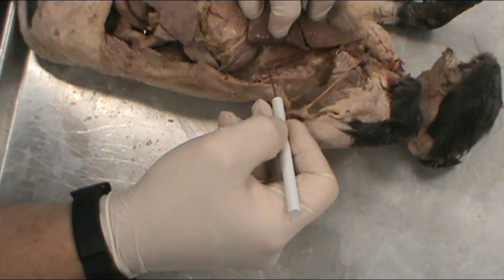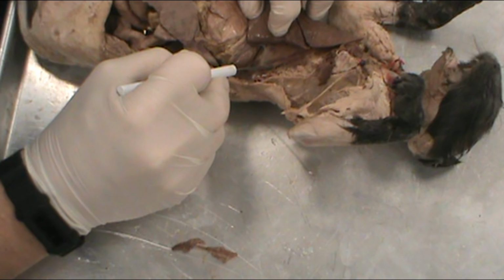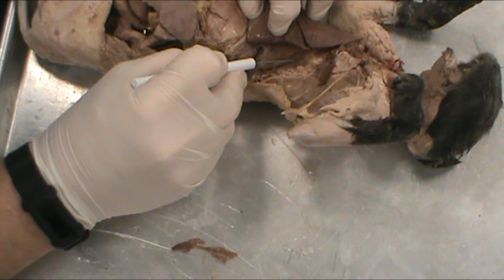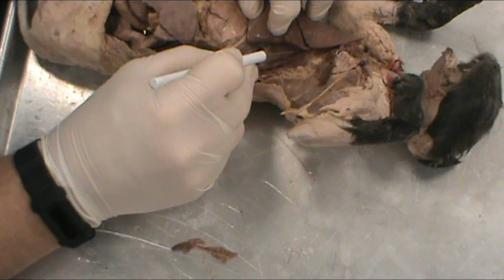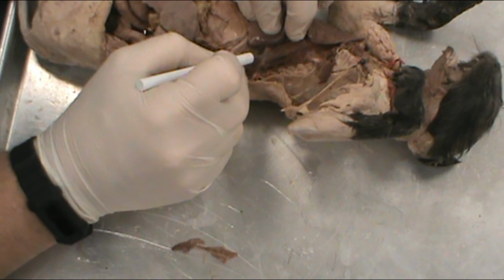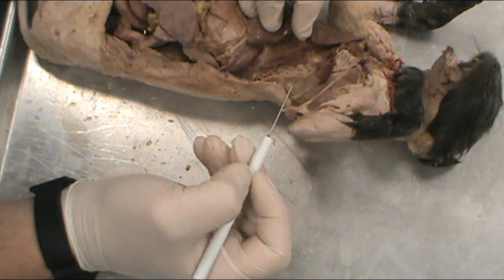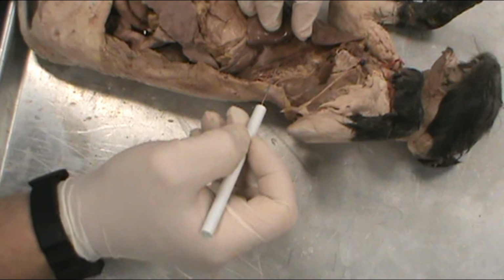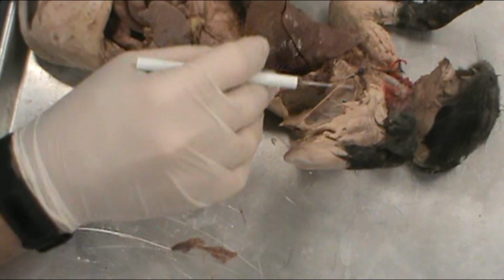You can see some of the pink dye here. You can also see a lot of the pink dye leaving the aorta and heading towards the spine. The reason this isn't very pink is because the aorta is a very thick-walled artery, and it's hard for that pink color to shine through because of how thick the artery wall is.